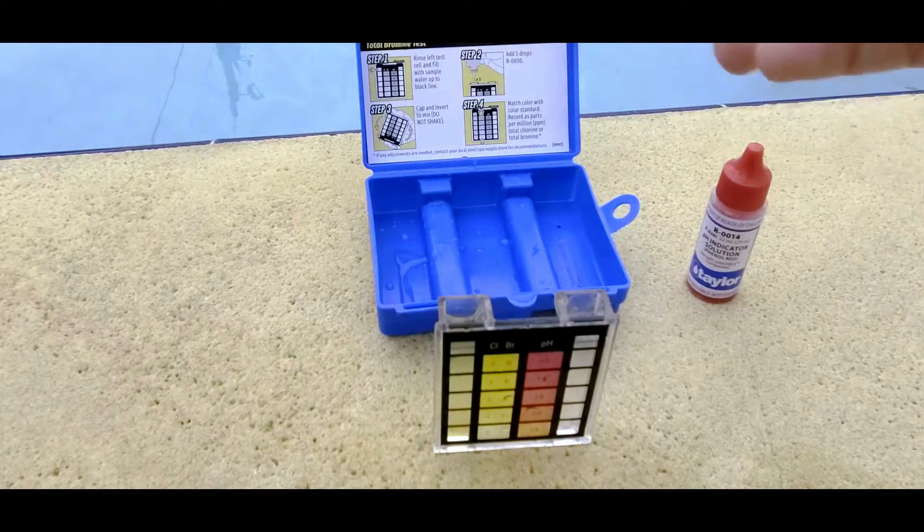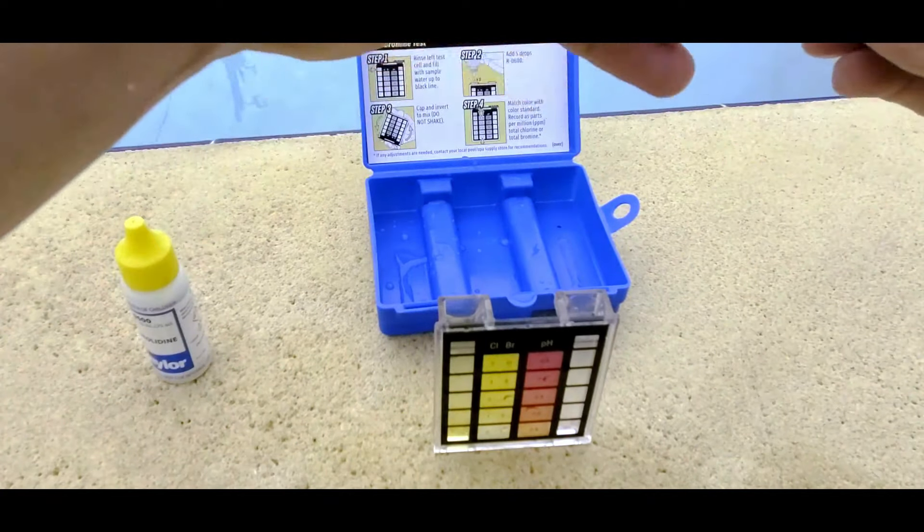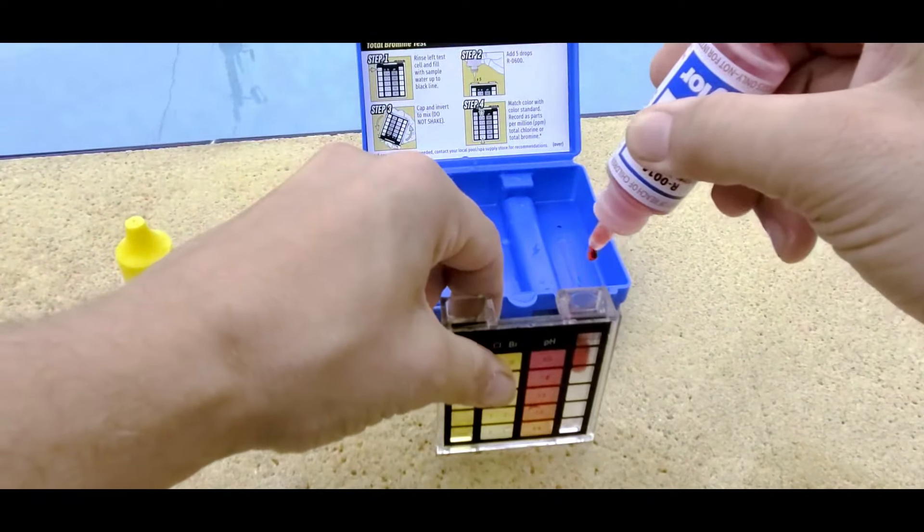And then we're going to add the five drops for the pH. One, two, three, four, five.